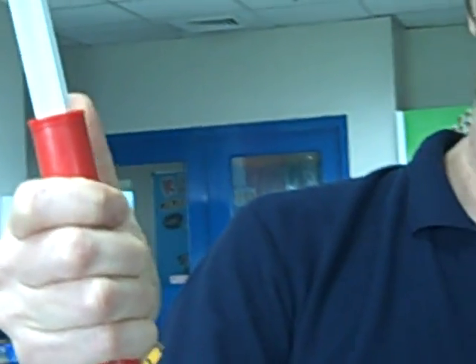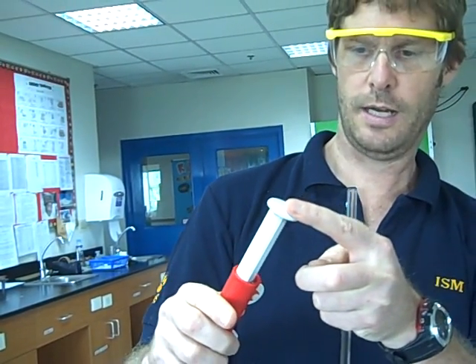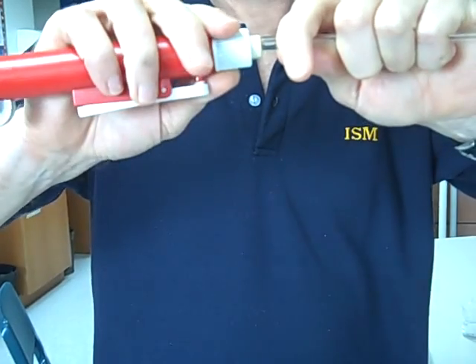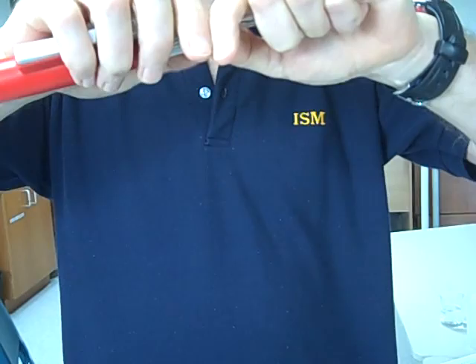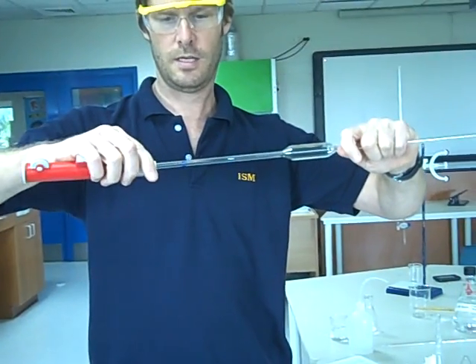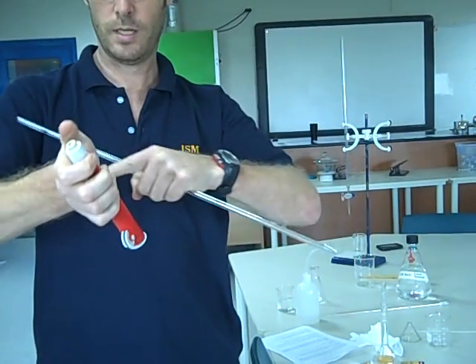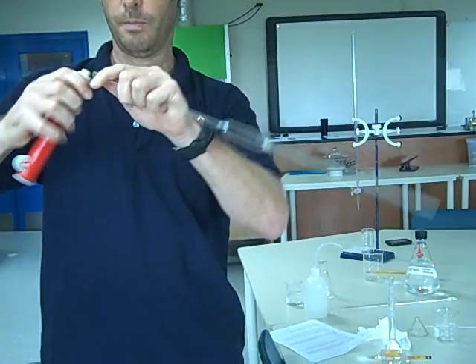Pipette filler, we roll up like this with one finger, and then we can let out liquid by pressing this. However, I'll show you a slightly different way. These have to be placed on the pipette. We hold the glass tube close to the end and place it on here. I urge you, please, to hold it like that, not like this, as you'll find that if you force this, this can snap, the glass can go into your vein here, and you can spread blood across the lab, and I don't want to have to clean up after you, so care.